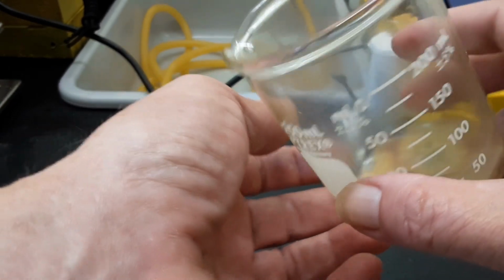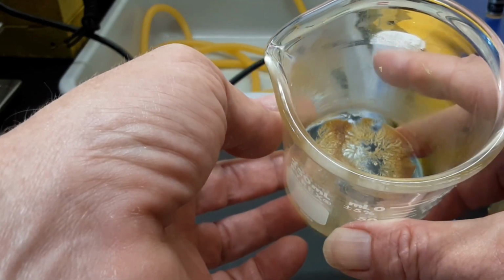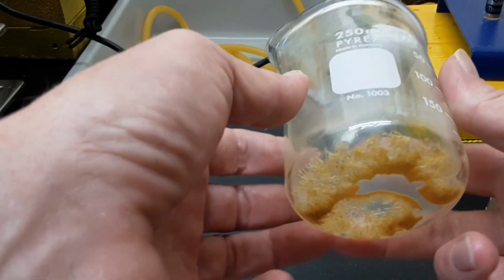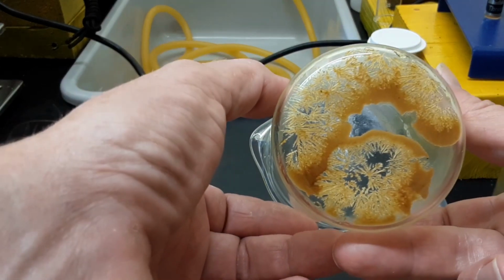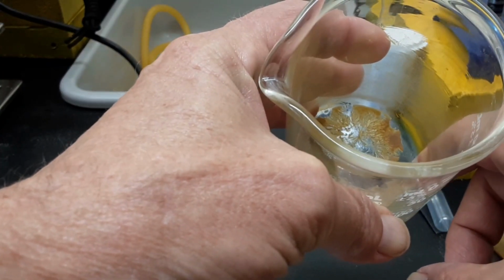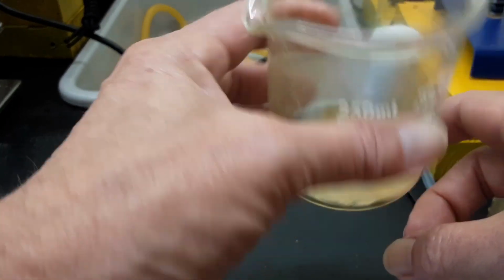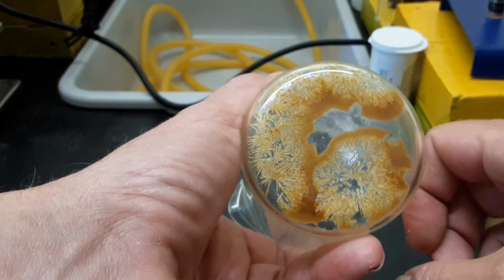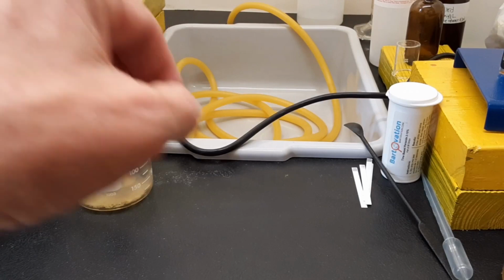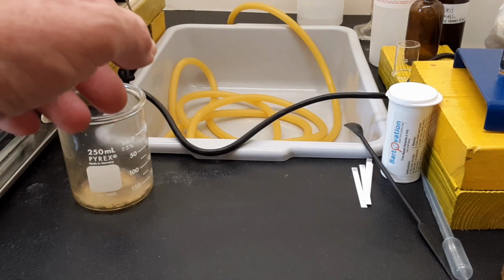So unfortunately that took the piperine with it. But honestly, there was hardly any piperine in there even before the 4 or 5 times with acetone. I don't know what this brown stuff is. And that's the most frustrating part of this experiment, because if you don't know what it is, there's no chance that you can ever get rid of it. If there's 250 milligrams of crystals there, if you subtracted the brown out of it, I'd be very, very surprised. It was a 10% solution of potassium hydroxide. It was refrigerated for 3 days, and it looked really good prior to it going bad.